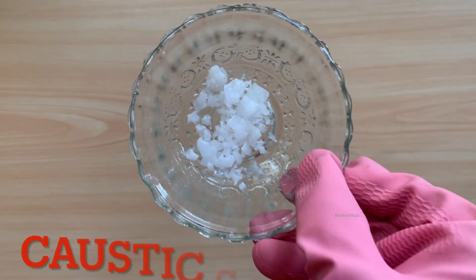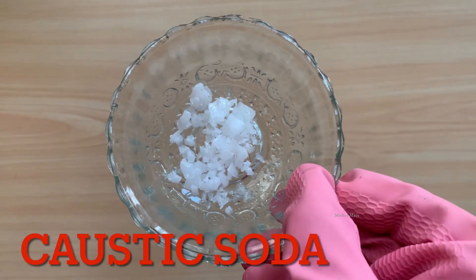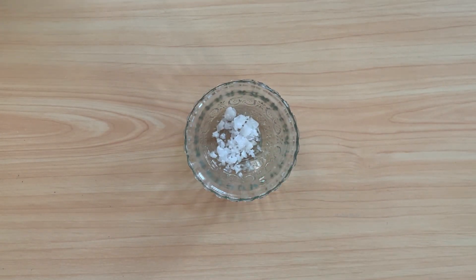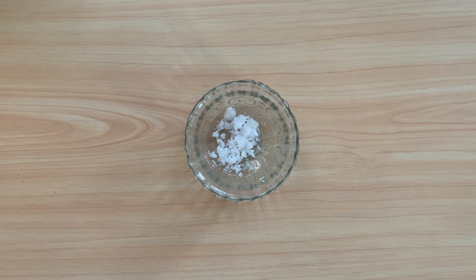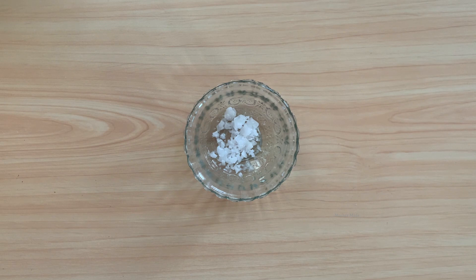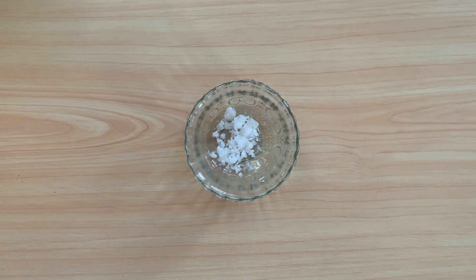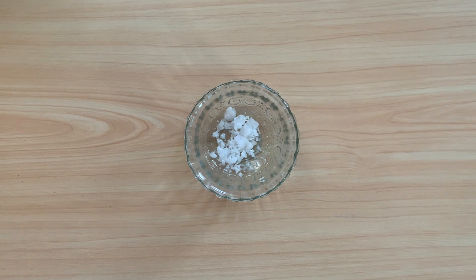This is caustic soda, also called sodium hydroxide. It is white in color and comes in the form of flakes. It is available at industrial chemical shops locally, and you can purchase it there easily, or you can purchase it online as well.